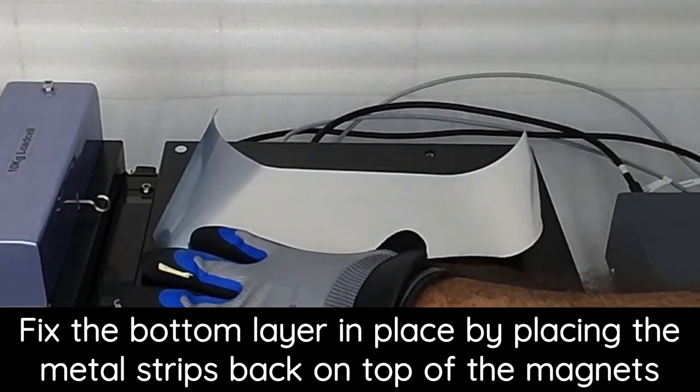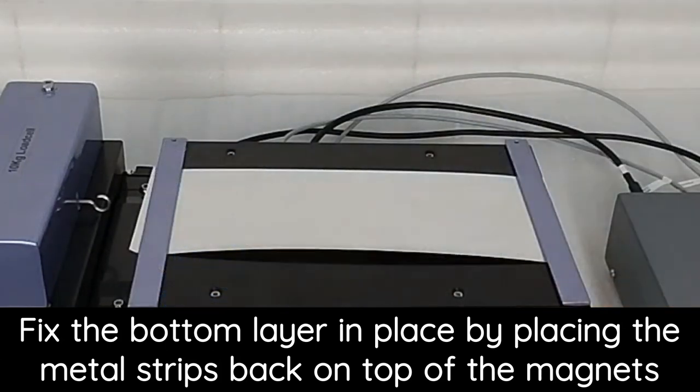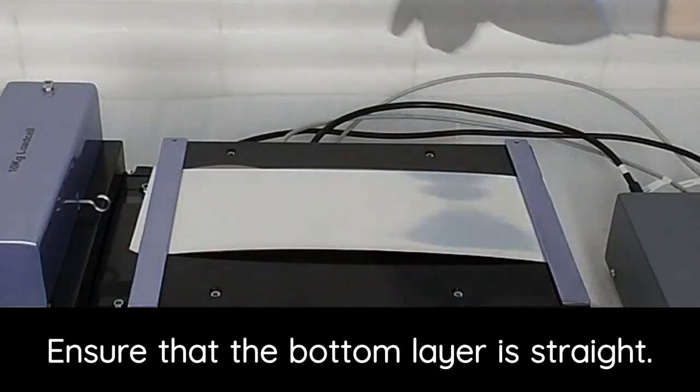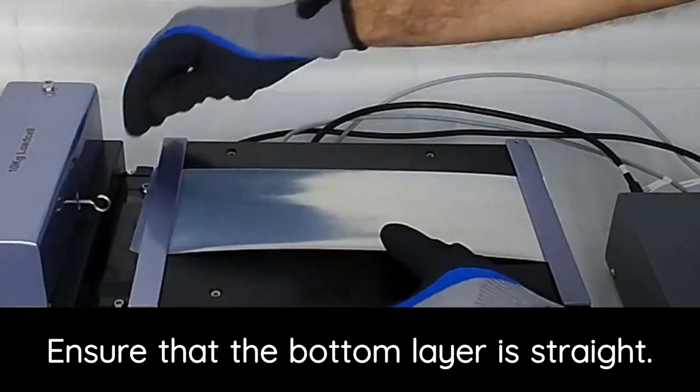Fix the bottom layer in place by placing the metal strips back on top of the magnets. Ensure that the bottom layer is straight.